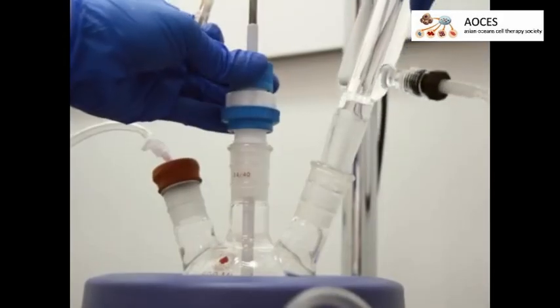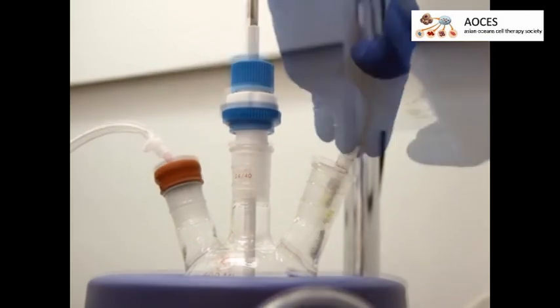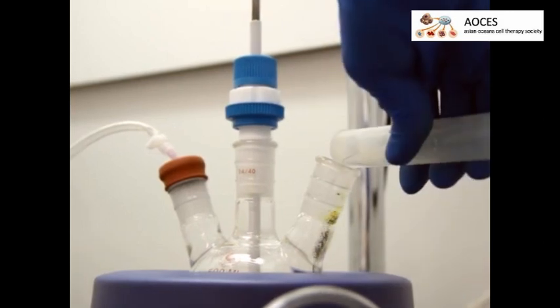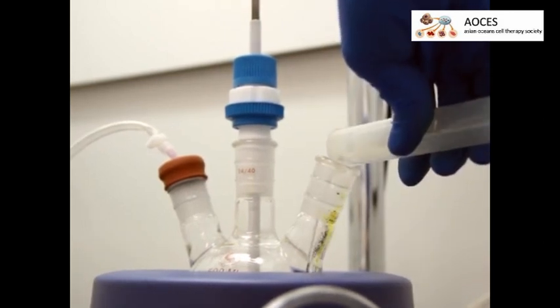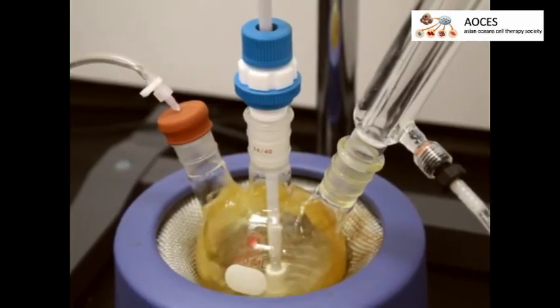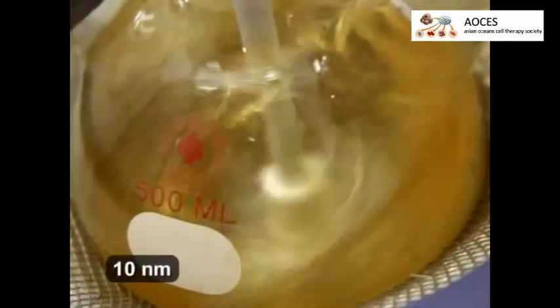Then remove the reflux condenser and add 1 gram of iron 3 chloride, 612.5 milligrams of iron 2 chloride tetrahydrate, and 50 milliliters of degassed water. Replace the condenser and stir the reaction at 1000 RPM while heating to 50 degrees Celsius. This will produce 10 nanometer diameter magnetite particles.